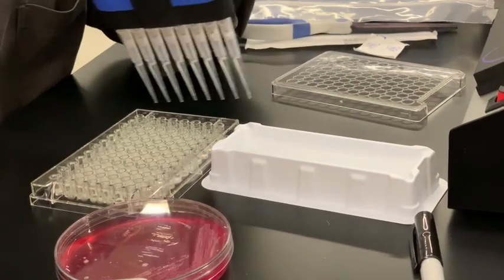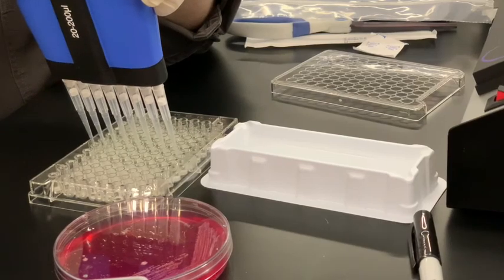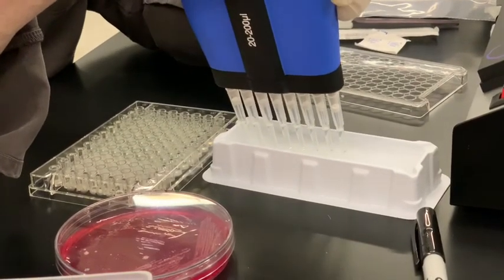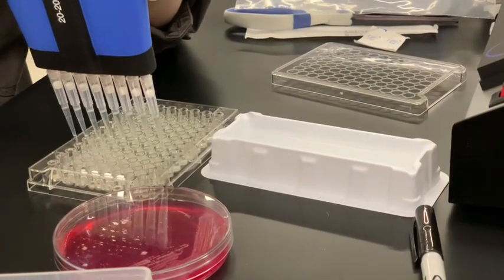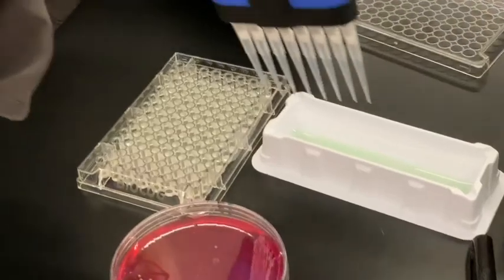Oops. I missed one. I was talking to you and not paying attention. It's a good idea to look underneath, at the sides so that you don't miss one.